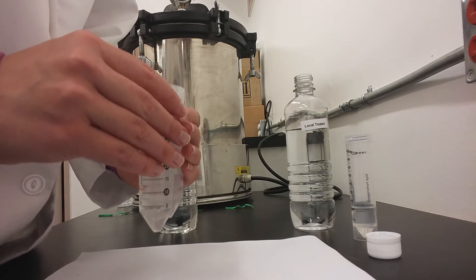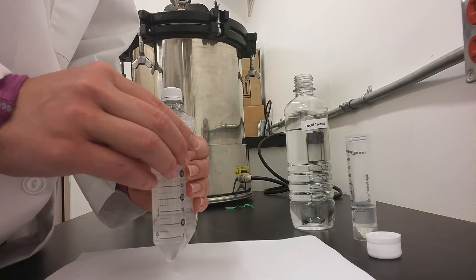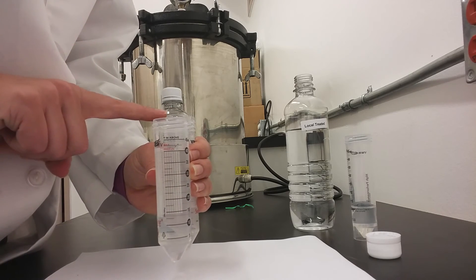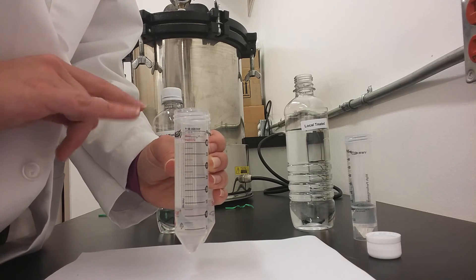Next, you will hold these samples directly over the paper, and looking down onto the white surface, you will determine whether any of the samples look lighter or darker from each other.